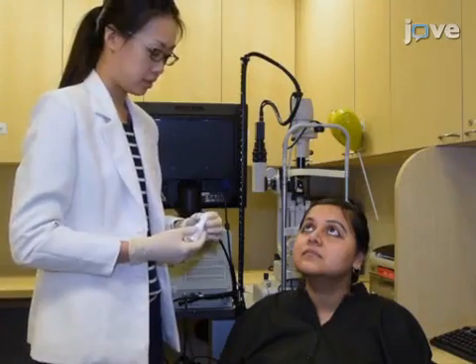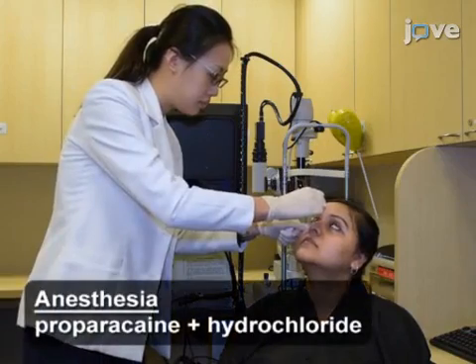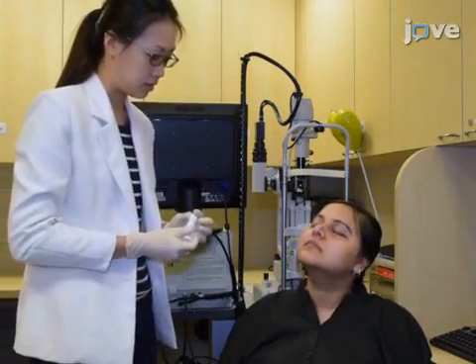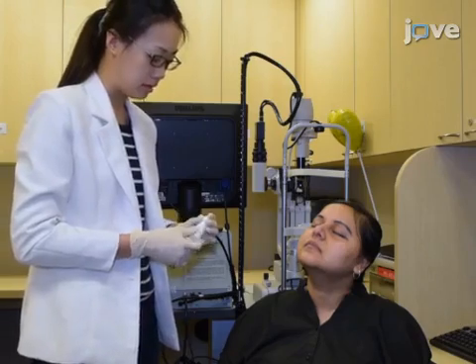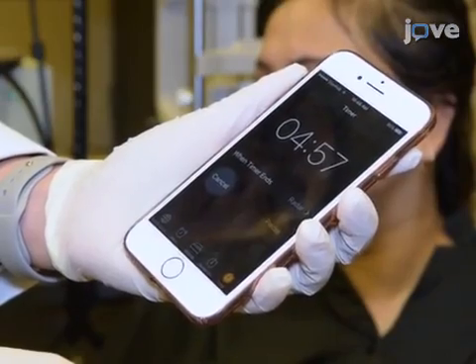After determining the participant's clinical status, apply 1 to 2 drops of topical anesthesia to the superior bulbar conjunctiva and the inferior fornix of the participant's eyes. Wait 4 to 5 minutes for the stinging sensation of the anesthetic to wear off.